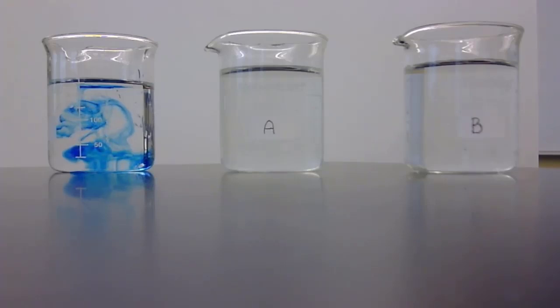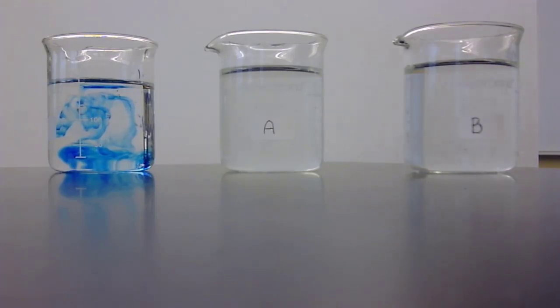Now, obviously, you don't have to watch it for the entire hour. We're going to record some of this, and then we'll go ahead and jump to the end. The other concept that we're looking at is osmosis, which is the movement of water. And water moves when solutes, like the methylene blue, cannot move. And we're going to do this experiment with a potato, or a chunk of potato.